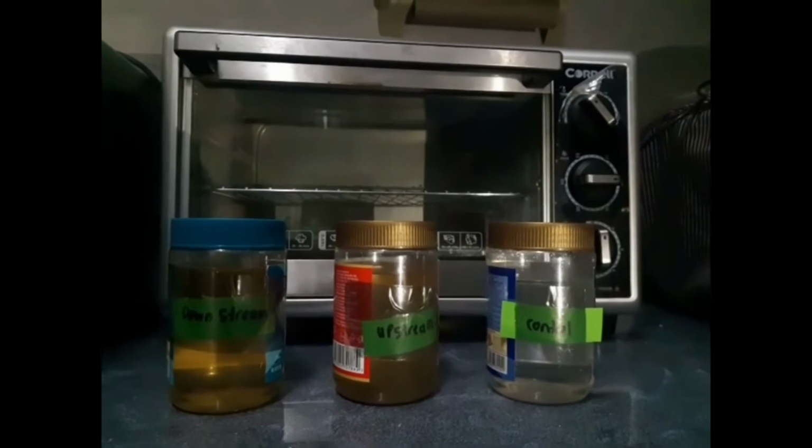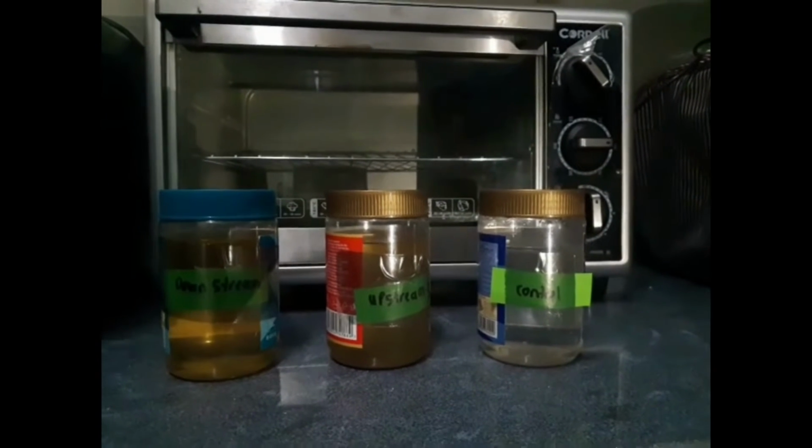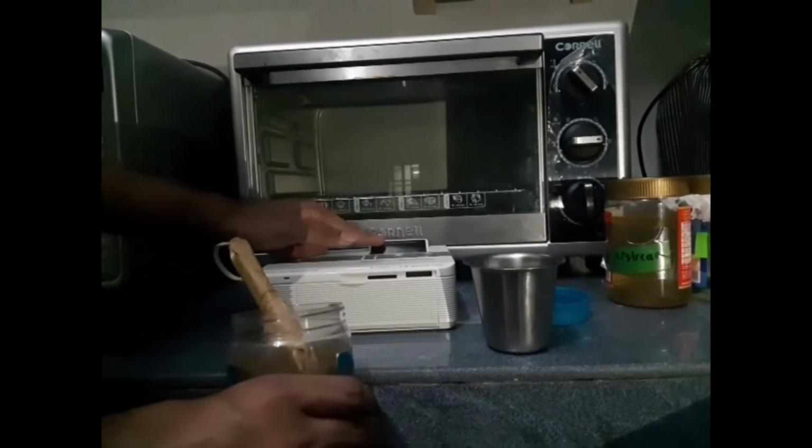Bacteria are important, so we will be checking for chlorine or other impurities that will affect the growth of bacteria. We will need to check the pH and neutralize with sodium hydroxide or sulfuric acid if needed. DO will be taken by an oxygen meter. We will wait until a beep is heard, which means the reading is stable.